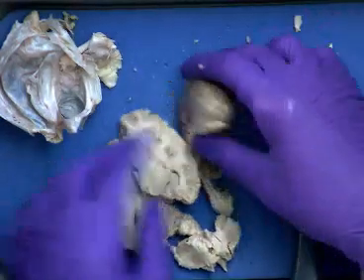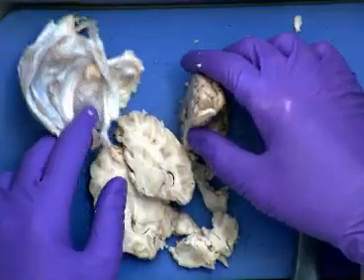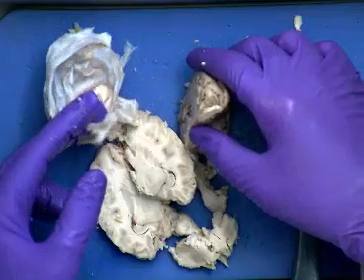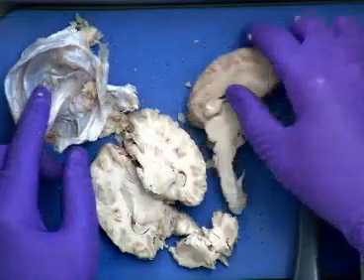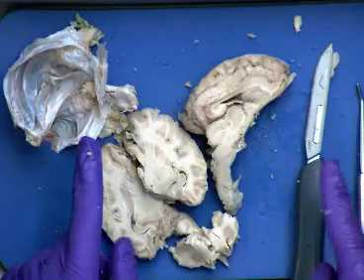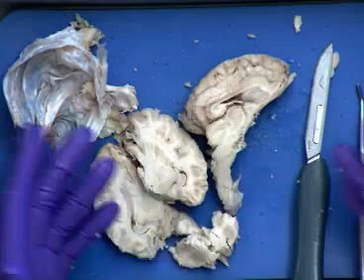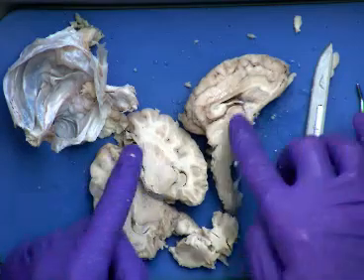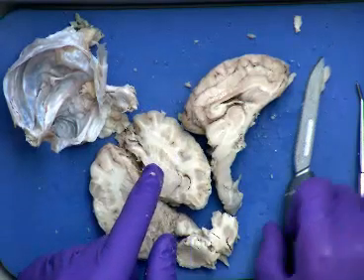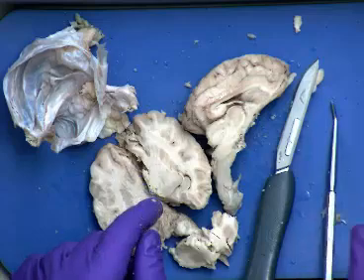You're just doing that mid-sagittal cut along the longitudinal fissure, removing any of the dura mater. Yours may or may not have the dura mater associated with it, but certainly be familiar that this leathery piece here is the dura mater. Okay? You can be the person at your table that watches the dissection, but you have to be able to identify those structures. So you're going to need a tray and a brain, a scalpel, and then some sort of a probe like this. We have blunt probes over there.